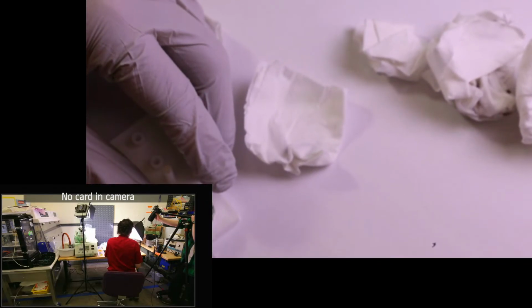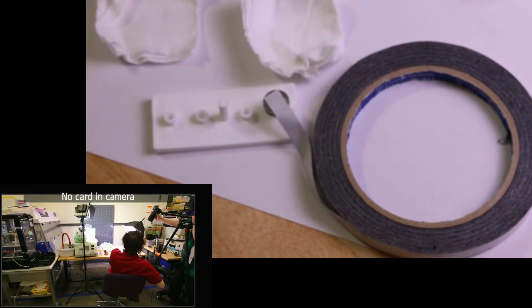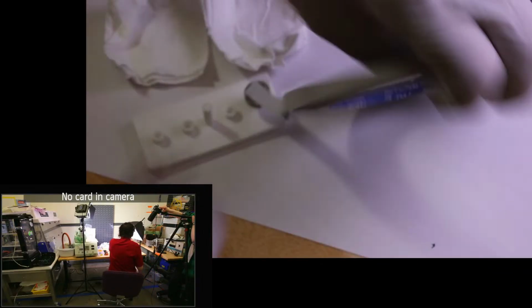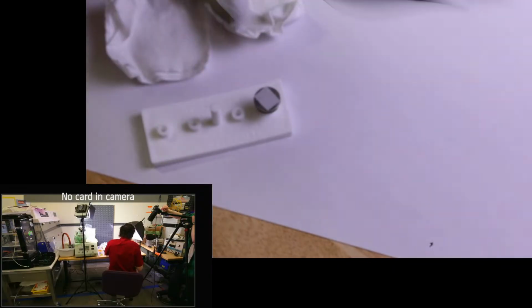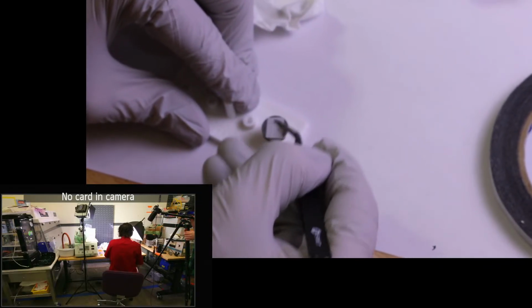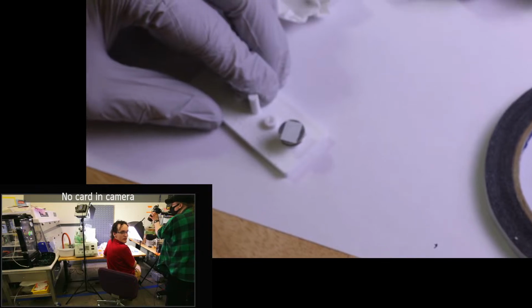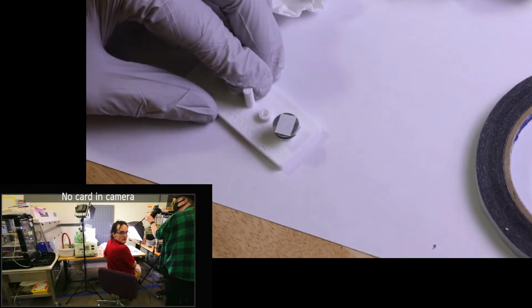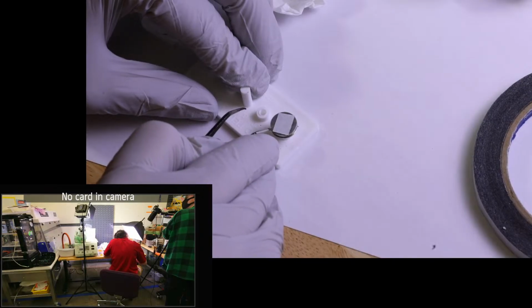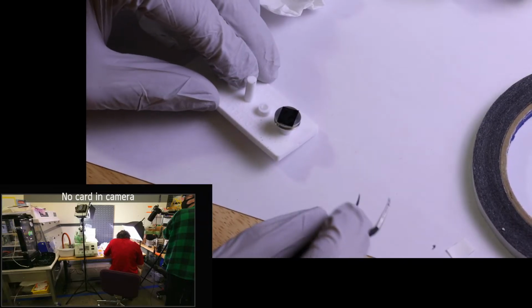So we'll do like that, and then touching things that are not as clean now. So we're not touching our samples anymore. We're going to go ahead and do the little snip snip. Done our snip snip. So press that down really nicely. And we will try to get focus going. Yeah, it's being silly. Cool. And so we'll go ahead and peel off our double-sided tape. There we go, we got some carbon. That's a particularly rough one.